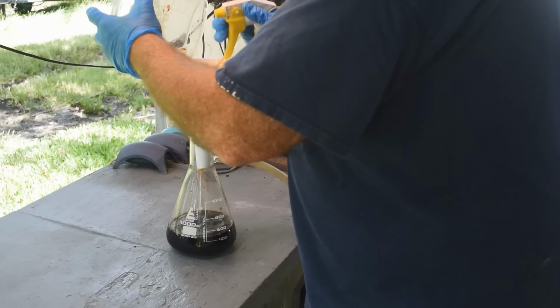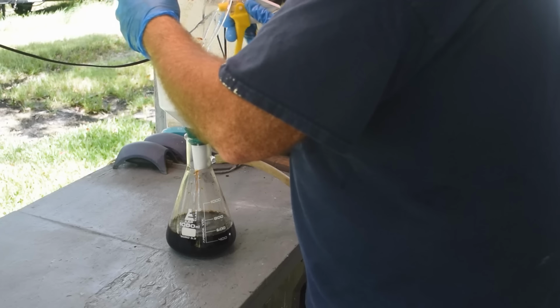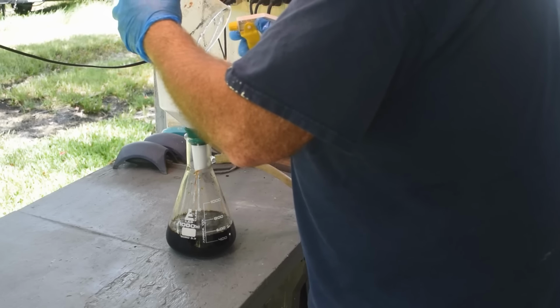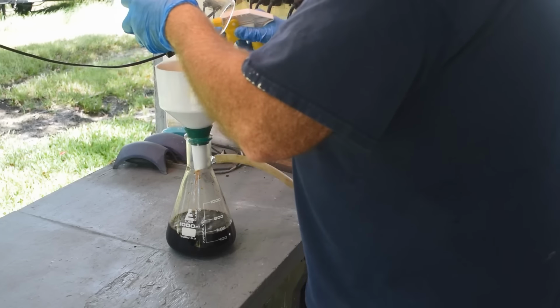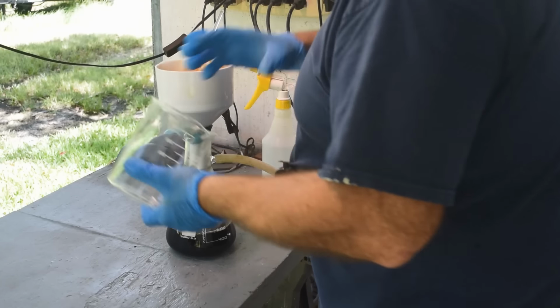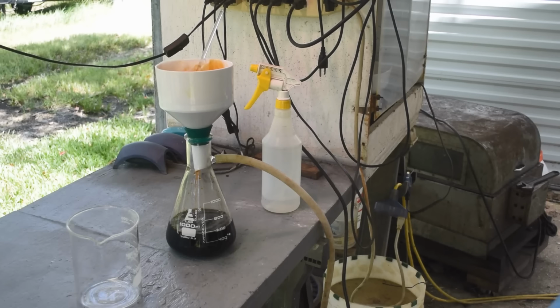Okay. Let me wash this beaker out into here. And we will just let this run. Pull as much liquid out of it as I can. And I will run a lot of distilled water through the filter to try and get as much of that red-orange color out of the filter as I can.